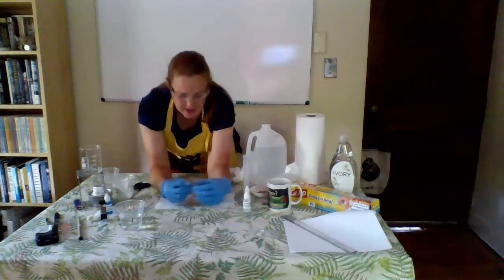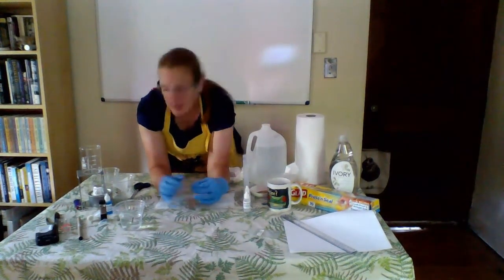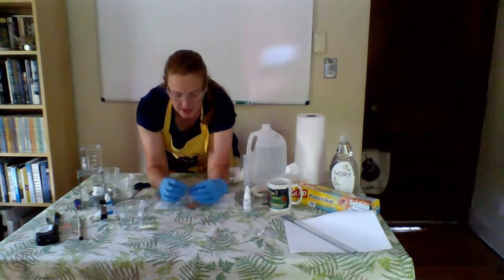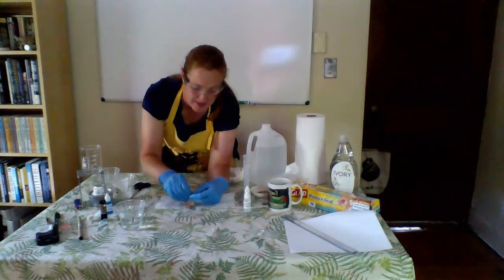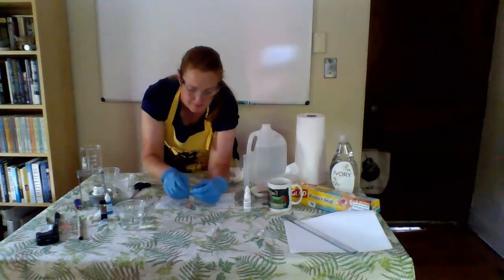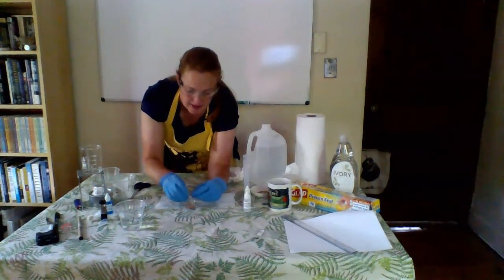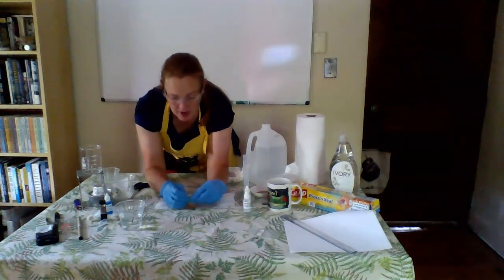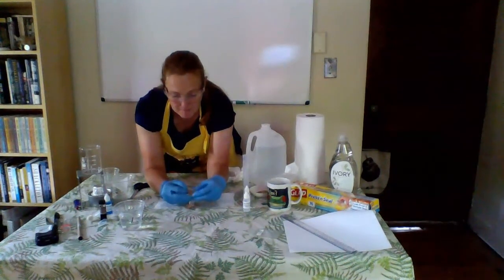Set this off to the side. Squish all the air out of your model cell. Give 2 big generous folds. We want to leave a little bit of floppy space in here. We're going to tie it with a rubber band on the other side. Make sure we got a really good seal. And then the next step will be to add the iodine to cup number 1.